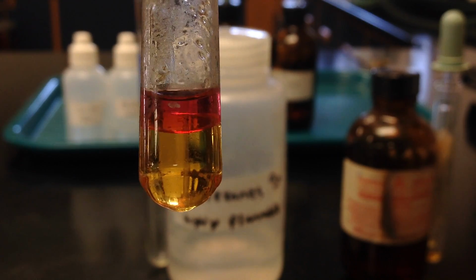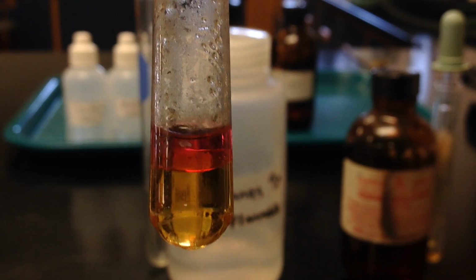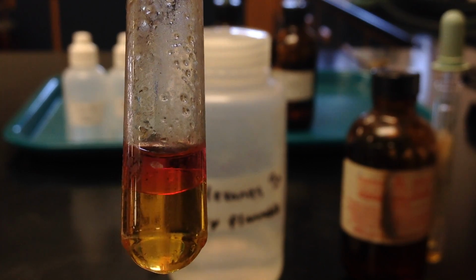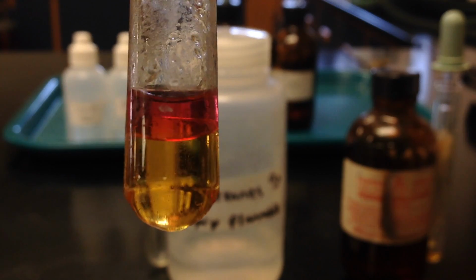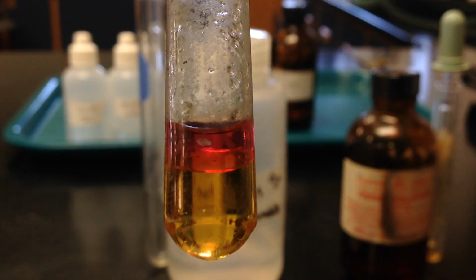So this hexane layer is kind of a pink or magenta color, and that's the test that we're going to use to find whether we're looking at bromine by itself as an element in the lab, or whether we're looking at iodine by itself in the lab. So again, if it turns a magenta layer, that means that the iodine is by itself.